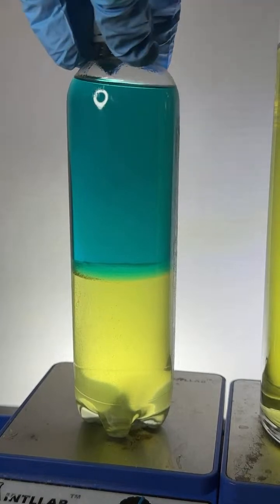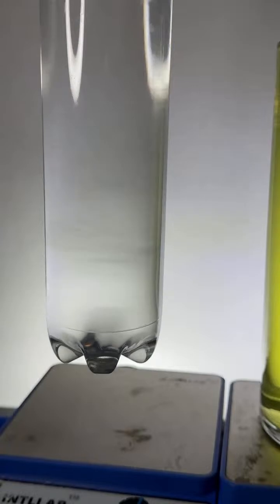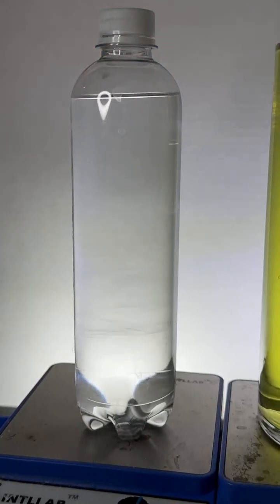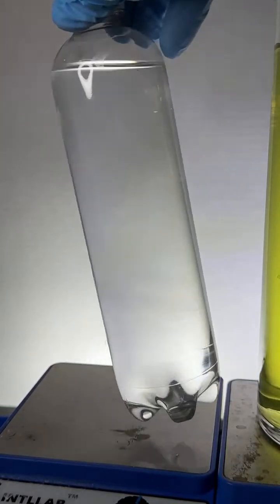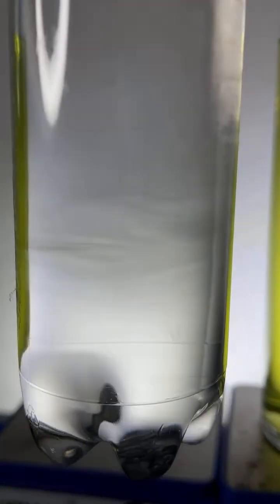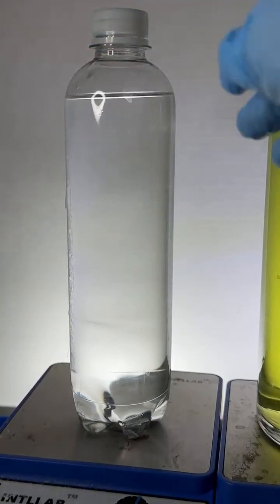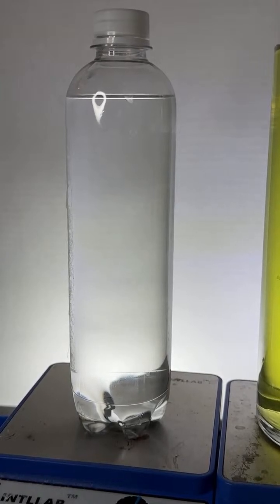So here's how you do this trick. I've got this bottle here. And if you look carefully, you can see there are two layers. Look right here as I fiddle this around. You can kind of see that. There's something funky going on there. That's because to this flask, I added both water and some isopropyl alcohol.